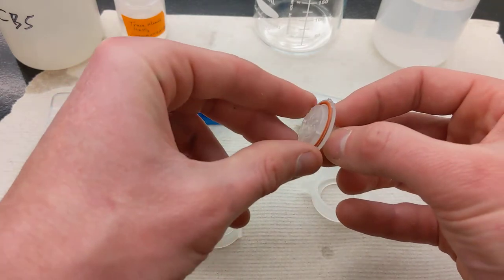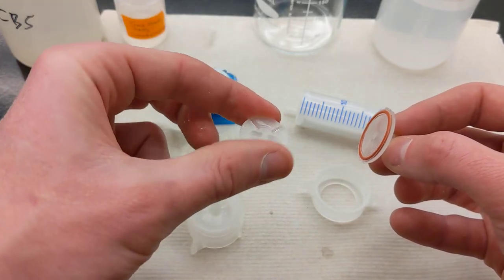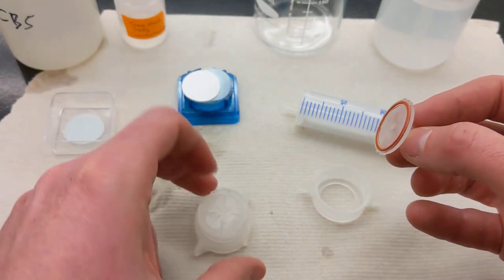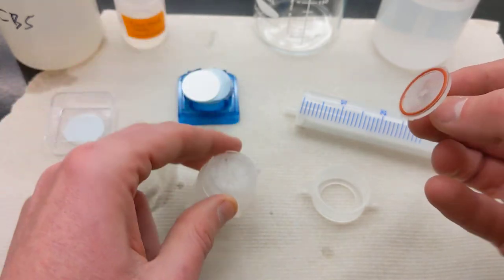So here's the base, and this is actually two parts. There's this disc, which just has slats in it. This is not directional, so this just pops right down into the base like that. There's no keyed sections, so it just rotates freely in there.